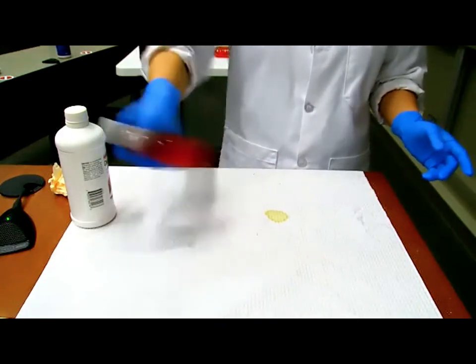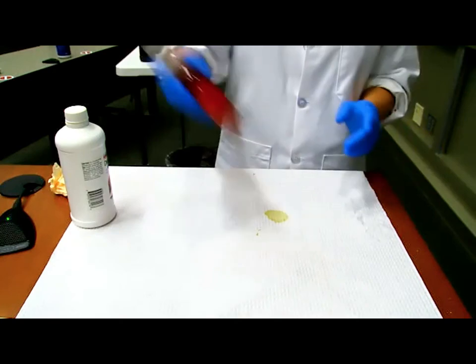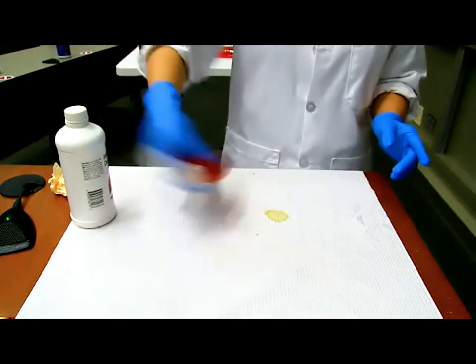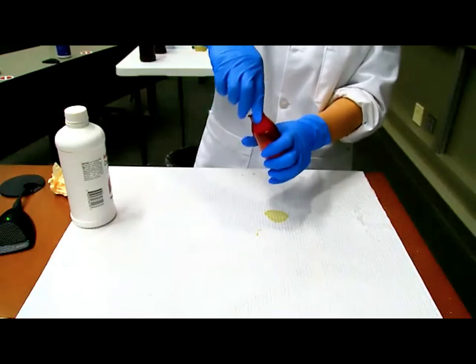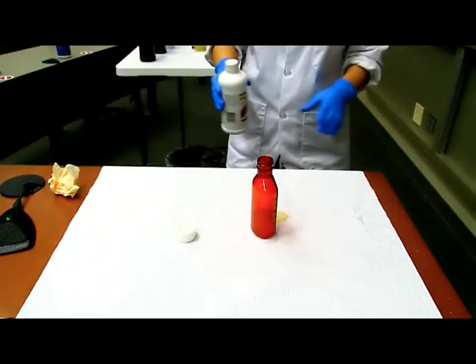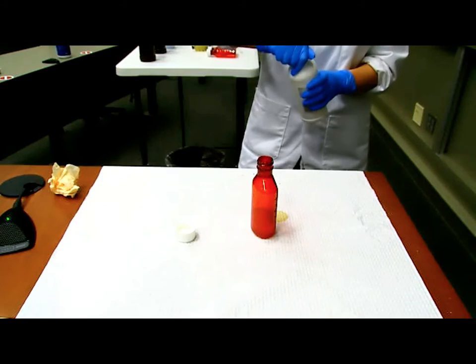Dr. Wu, why did you start with the mineral oil and not the cherry syrup? That's an excellent question. I need to think about which phase I want my oil to be in. In this case, I want to cover the flavor of the oil. So I wanted the oil to be inside. Therefore, I want to start with the oil. So a key trick, if there would have been a test on this, is to know that you start with the internal phase and add the emulsifiers to the internal phase, and then add the external phase last.